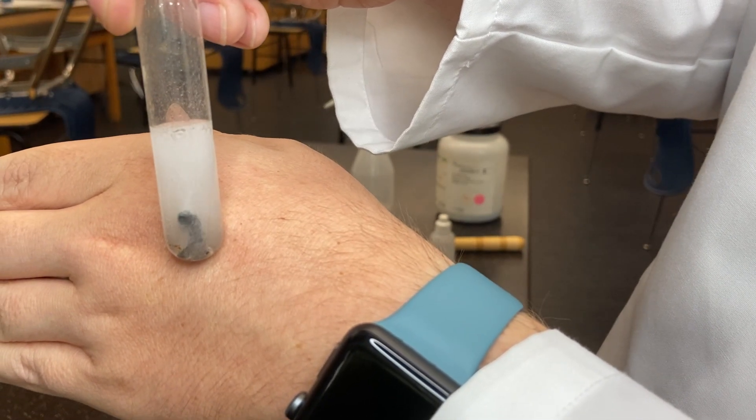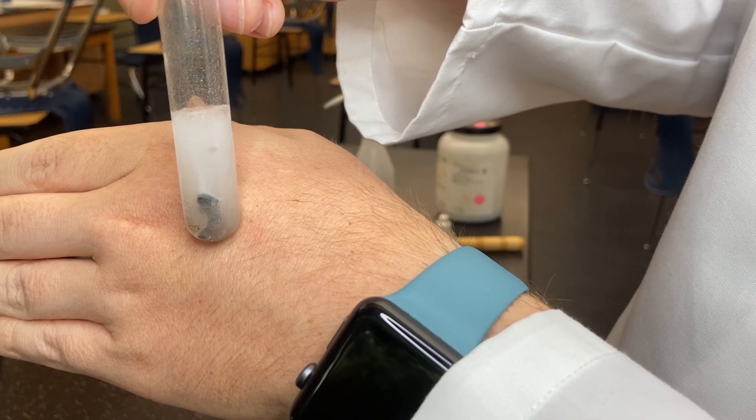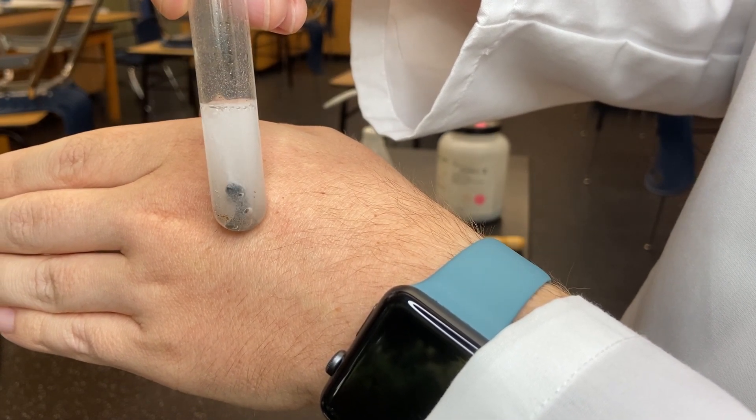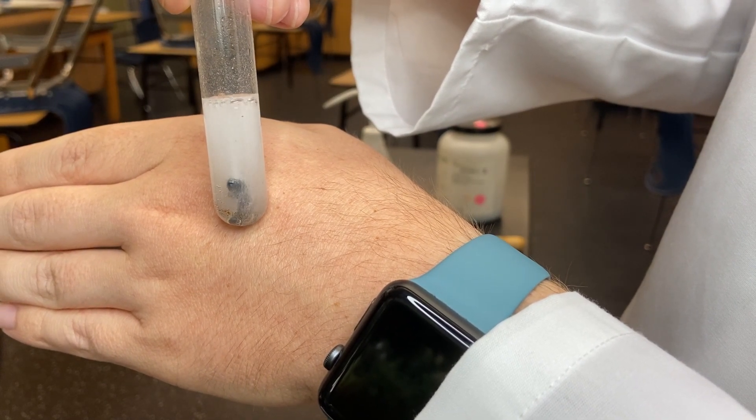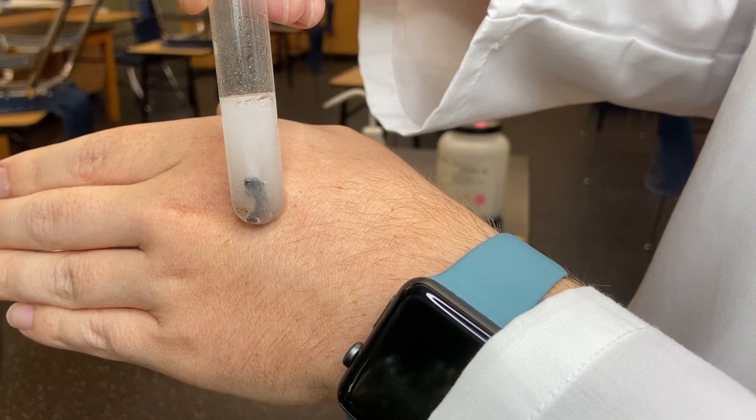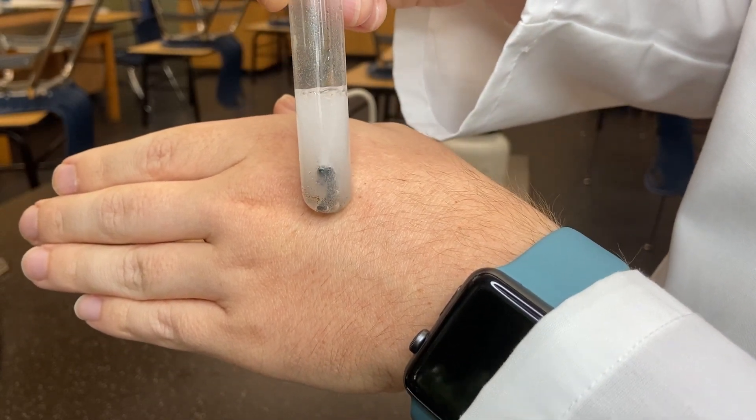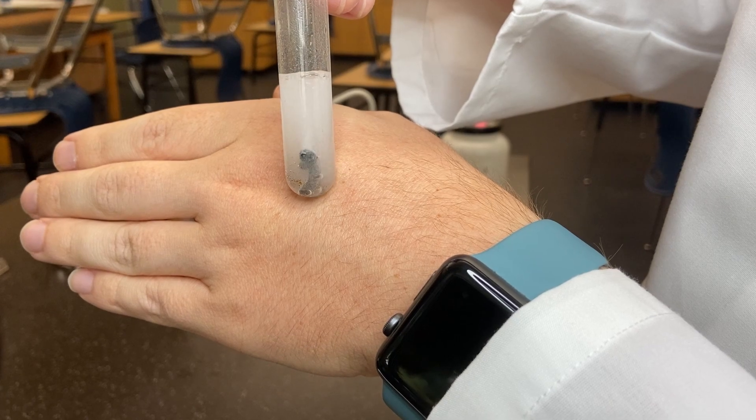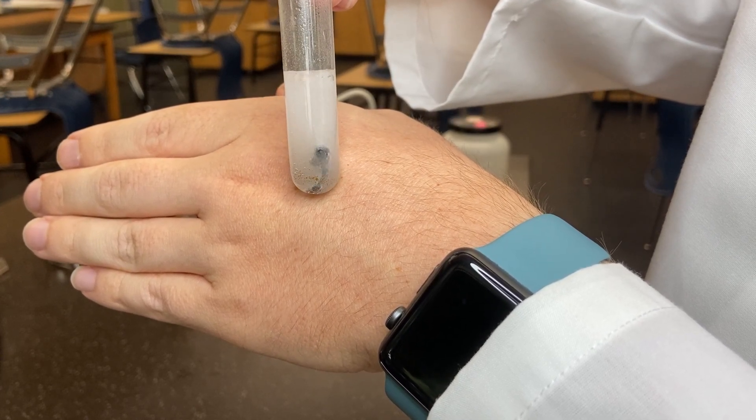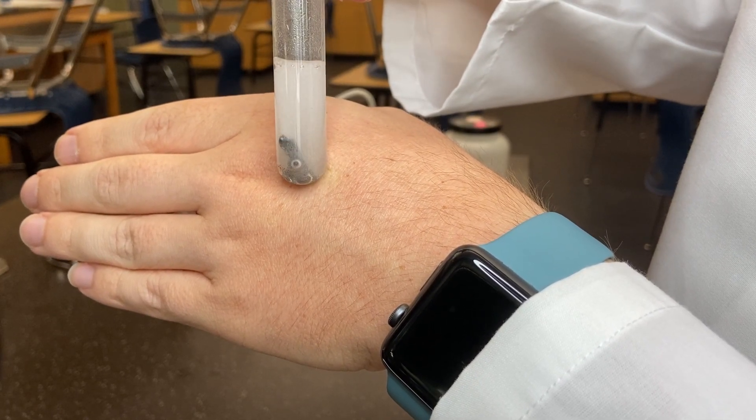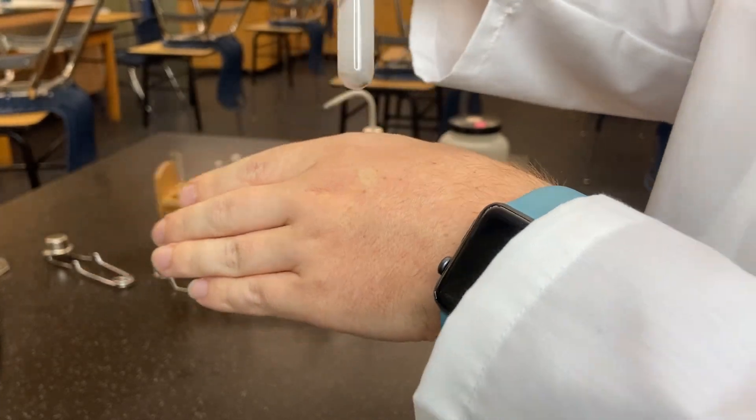This process continues pretty vigorously for a while, and I'll actually put this test tube back in the test tube rack and come back to it in a little bit to show you what it looks like after some time has elapsed.